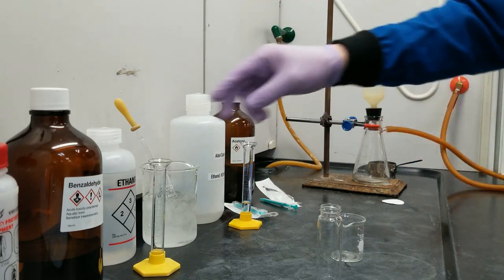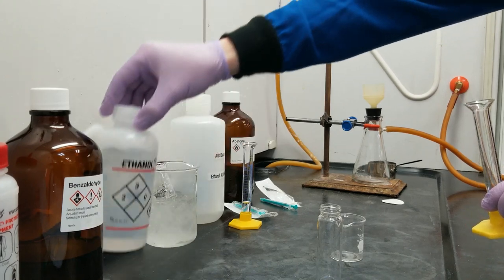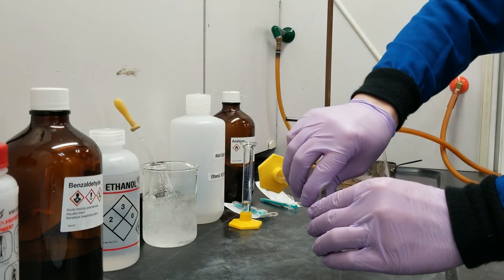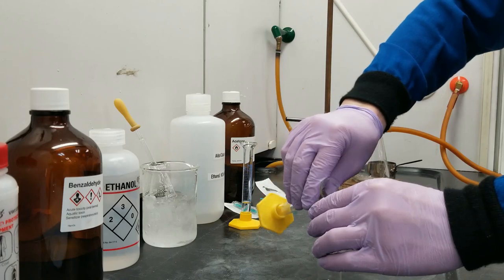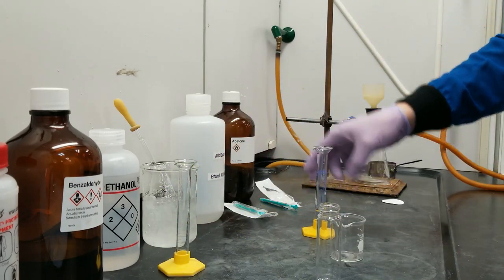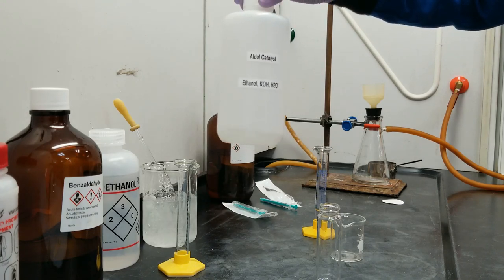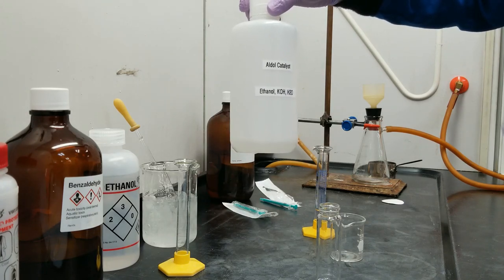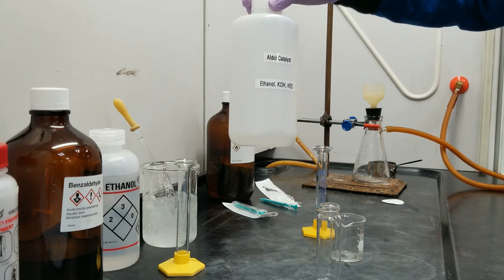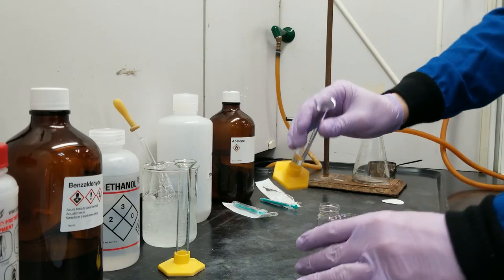Next I have some 95% ethanol. And lastly, this is our aldol catalyst solution, which is potassium hydroxide — our basic catalyst — dissolved in a mixture of ethanol and water. 3 ml of that going in.